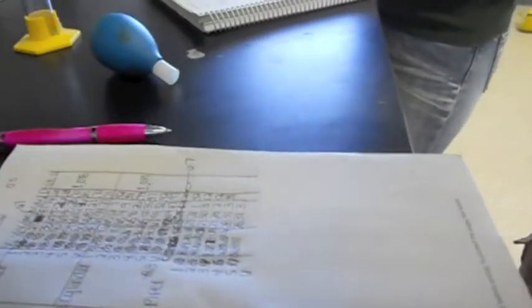So the mass distributed is 3 grams, and you enter all the excess.